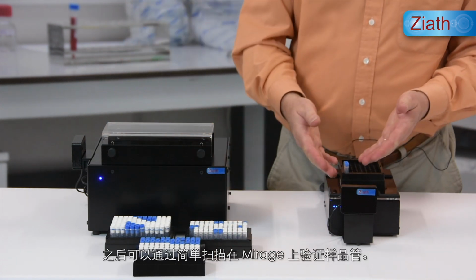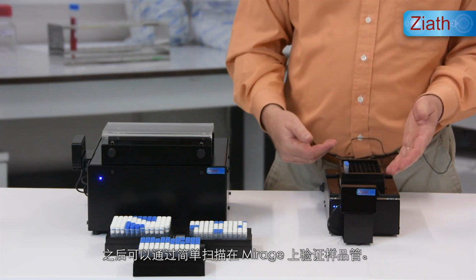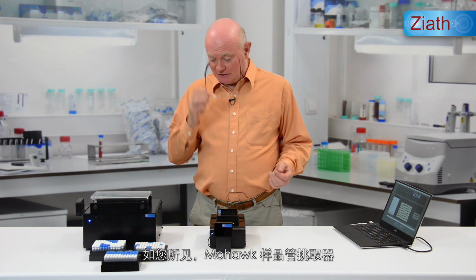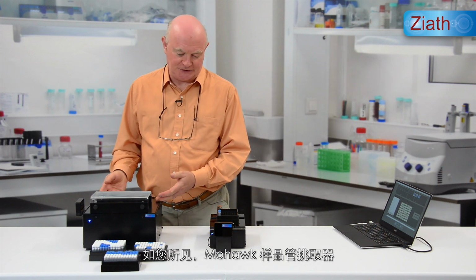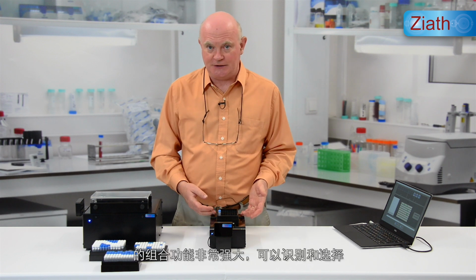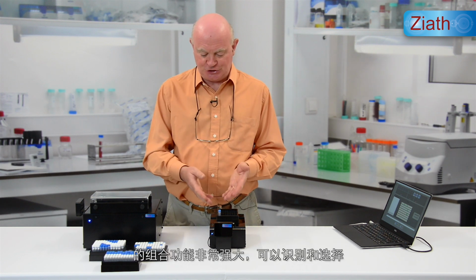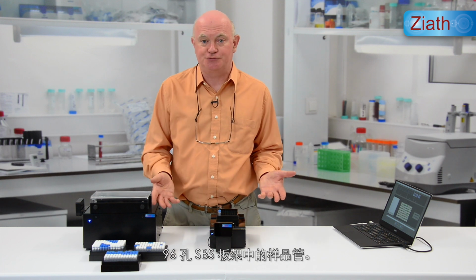As before, the tubes can then be verified on the Mirage with a simple scan. So as you can see, the combination of the Mohawk Tube Selector and either Mirage, Express or Cube 2D rack scanners is a very powerful combination for identifying and selecting tubes from 96 well SBS racks.